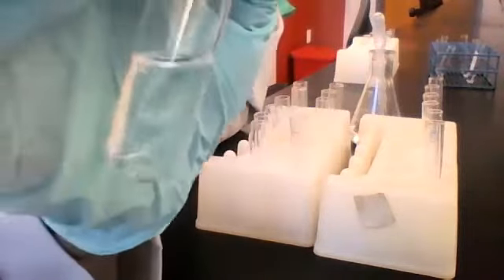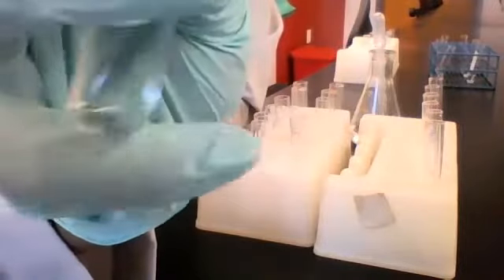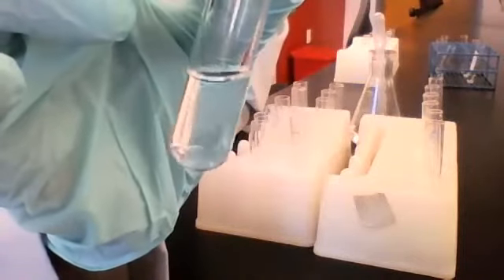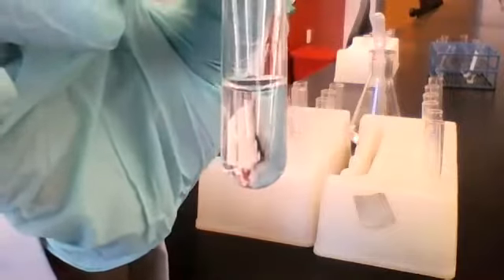Now we've seen this a bunch of times so far, so I'm sure you know how to describe this in your observations. From where I'm standing, I don't see any visible change at all. Would y'all agree? Yes, very good, thank you.